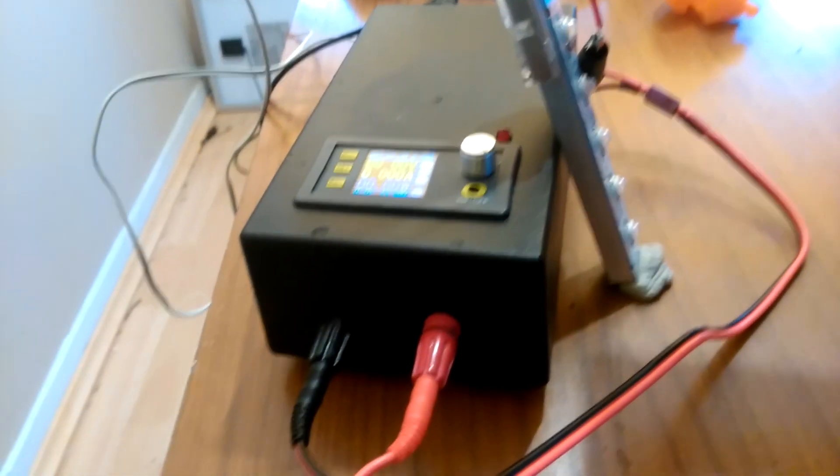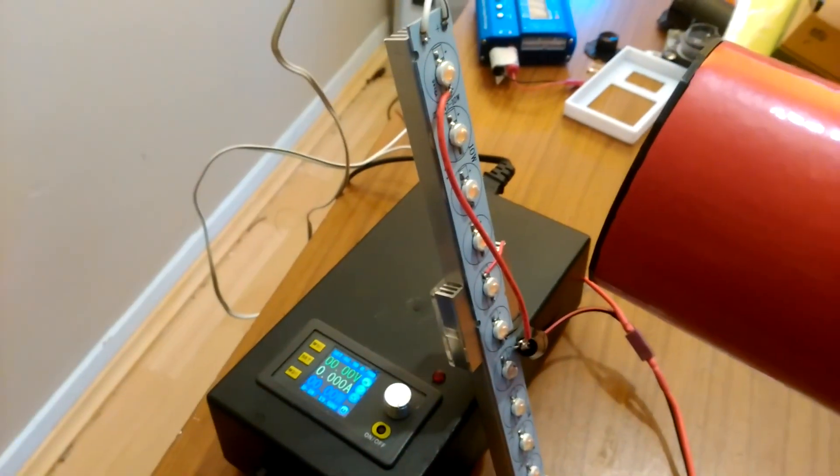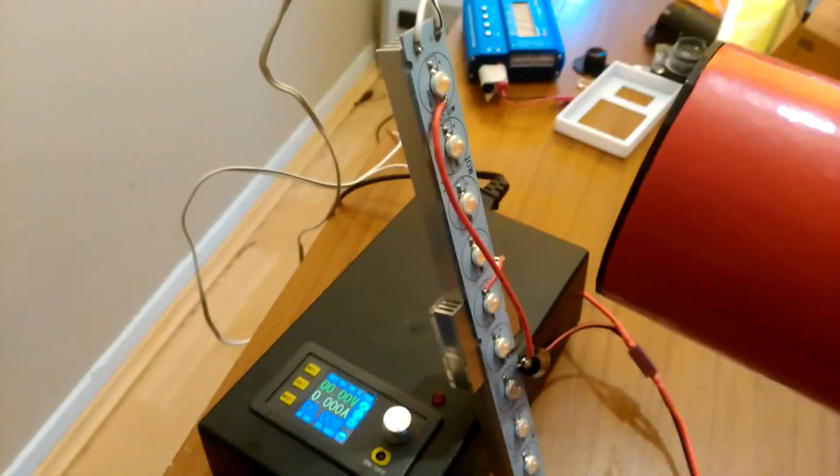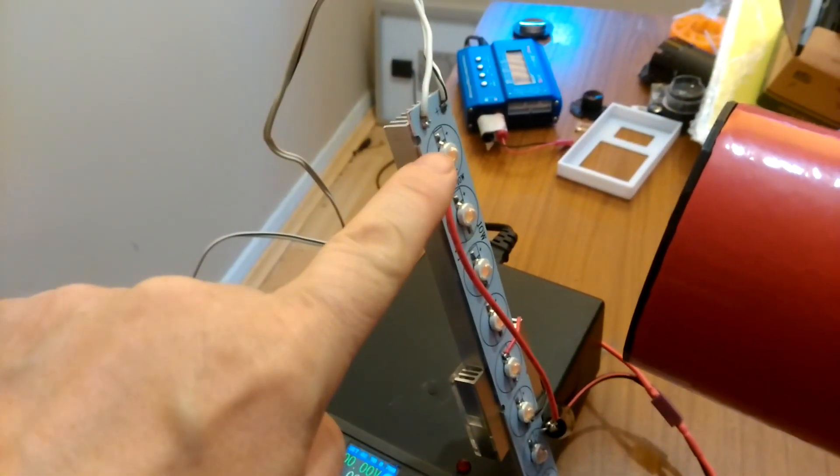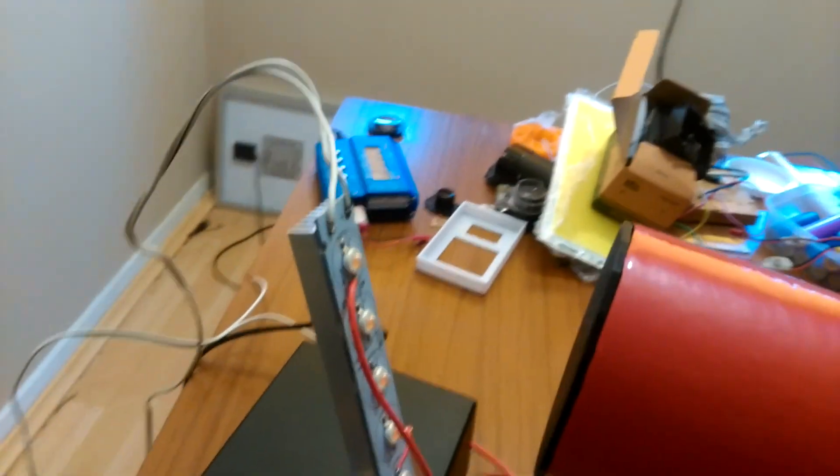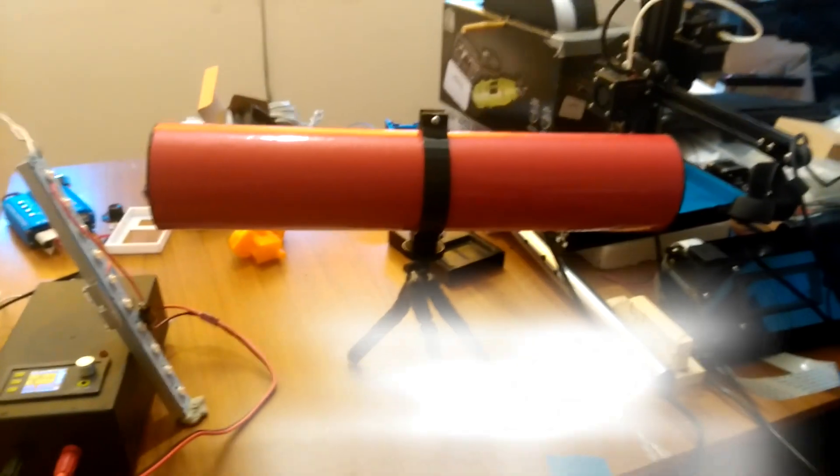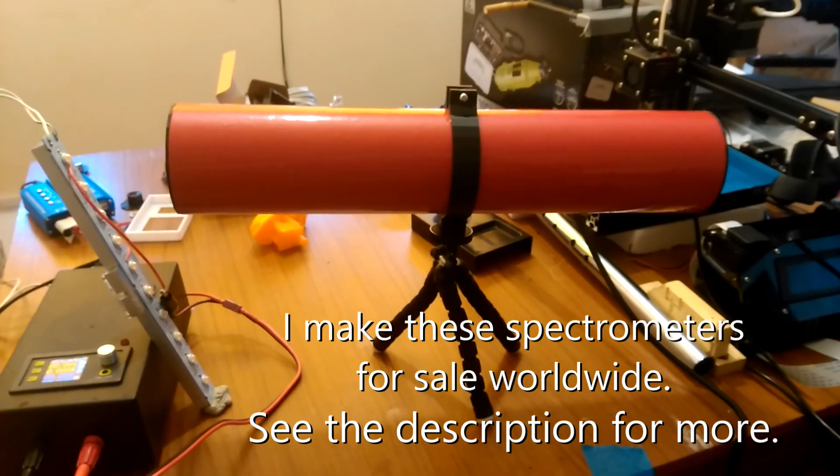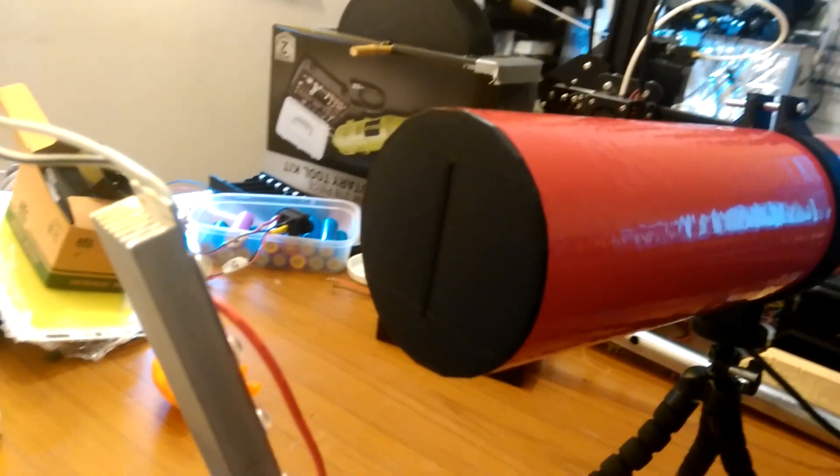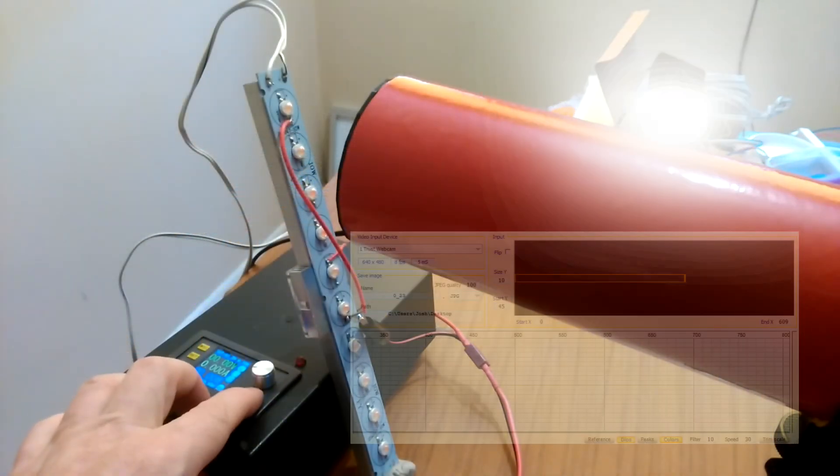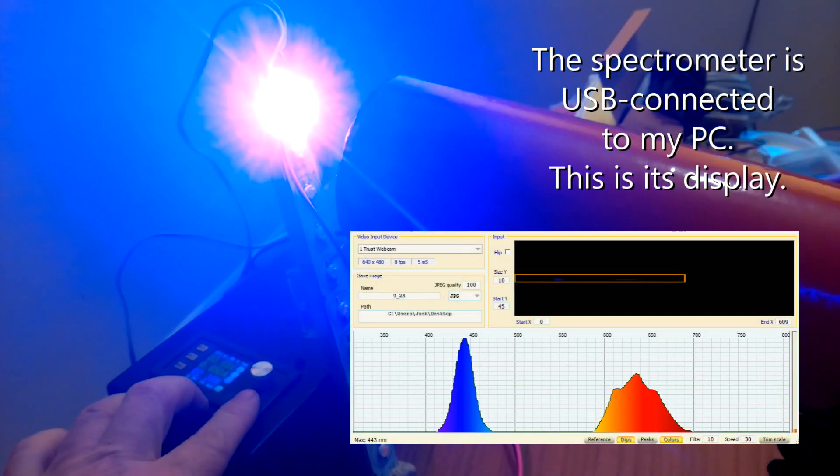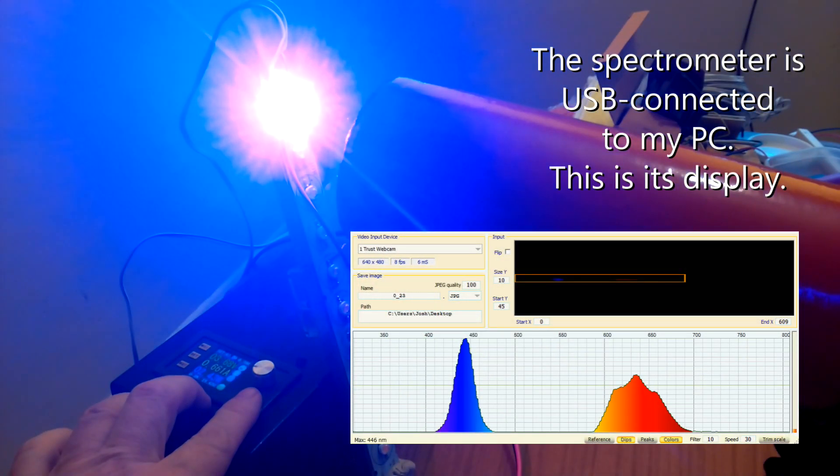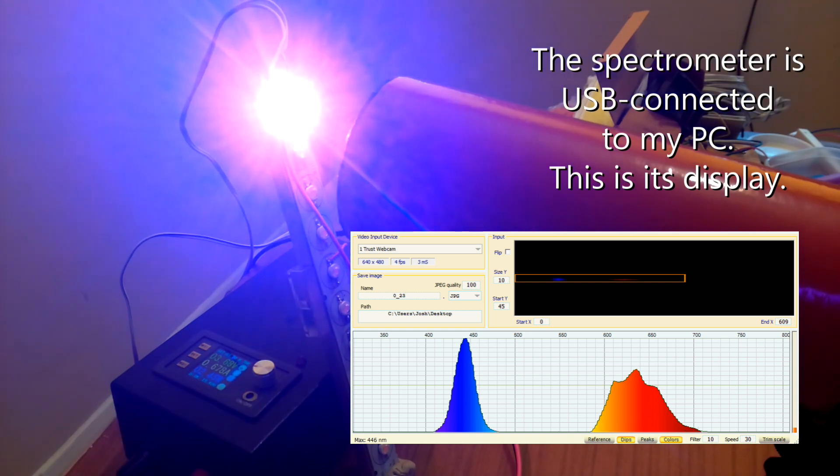The experimental arrangement is very straightforward, a little bit Heath Robinson but that's me. This top emitter is wired to come on and I've just taken my spectrometer on a tripod and pointed the slit at it. Just turn the LED on and there's the spectrum, simple as that.